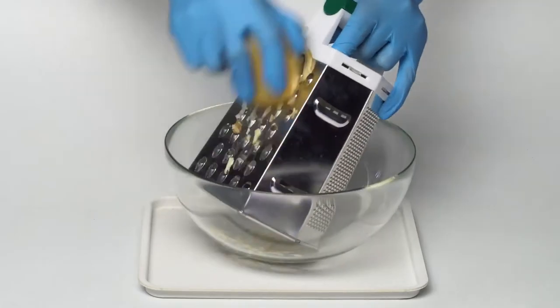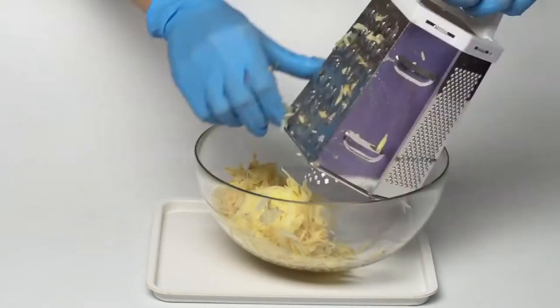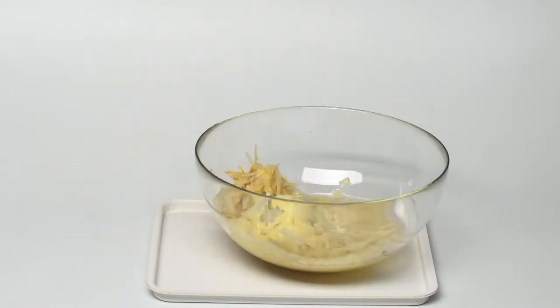Take a bowl and grate a potato into it. Add a beaker of water and mix the contents using the plastic spoon for five minutes.